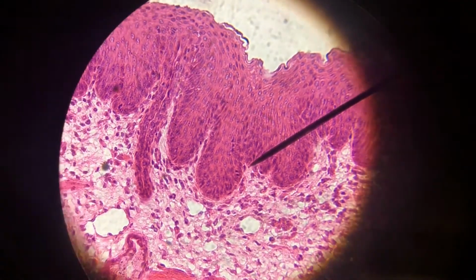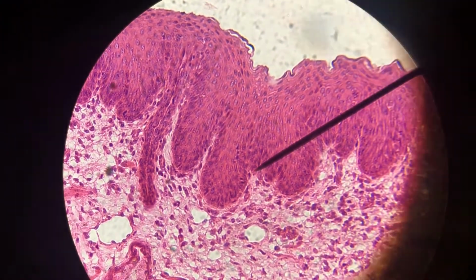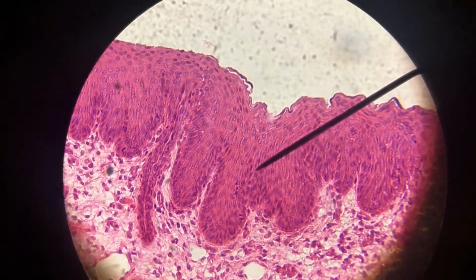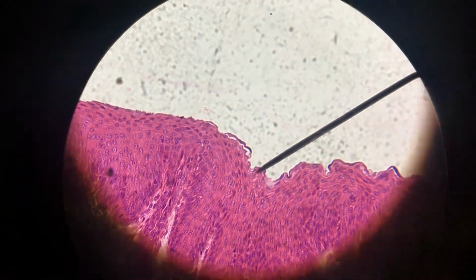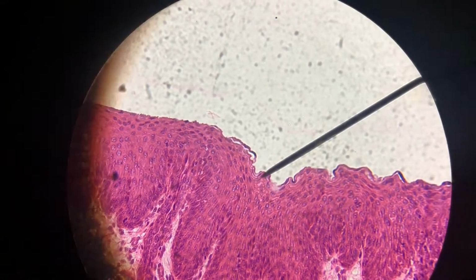It's highly cellular. Our epithelial tissues, that's another thing I don't know if was mentioned in class, are highly cellular. They've got lots of cells packed together. So those are many, many layers. And then it's non-keratinized, it's wet. You'll be able to tell the difference because when we look at the keratinized version, it's dry and you can actually really see that. All right.